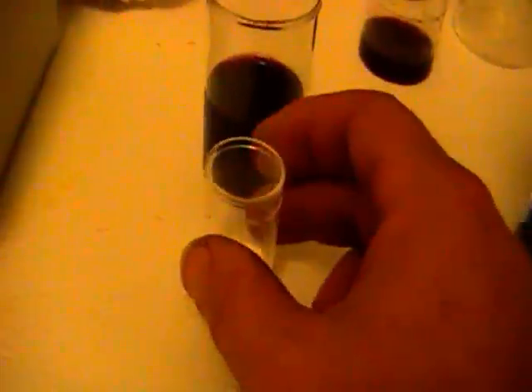So we take this little reagent here and we add it into our wine sample and shake it a little. Let me close the bottle of reagent before I spill it. By the way, watch this wine when I shake it a little bit — look at that nice stick to the side of the glass. Lighting is not so good so it's hard to see, but boy it's beautiful. Now we take our reagent and we drop it in — that has a little chemical reaction thing going on.